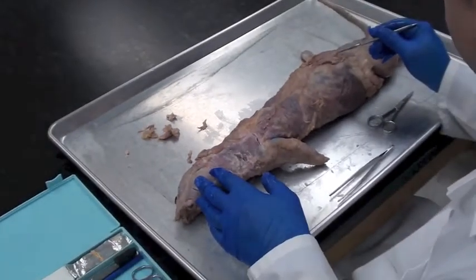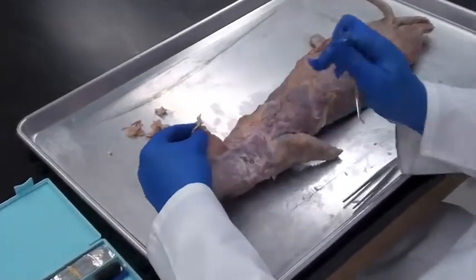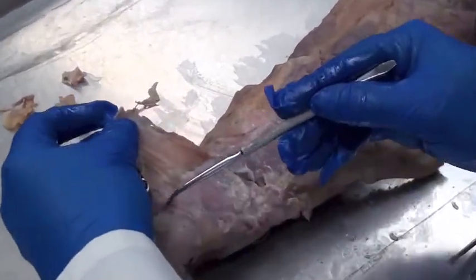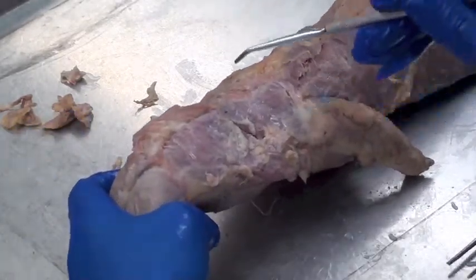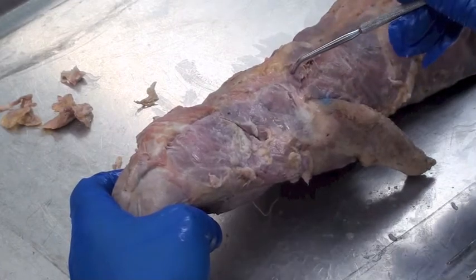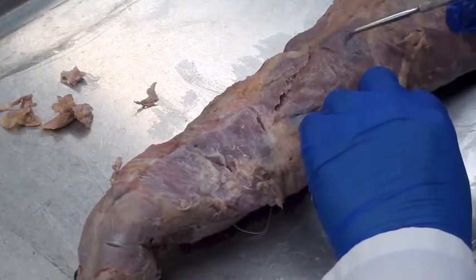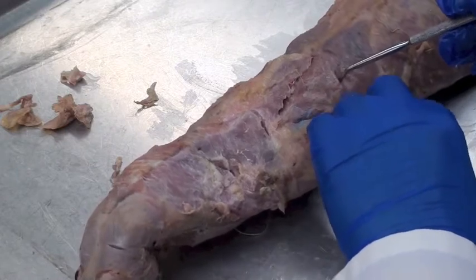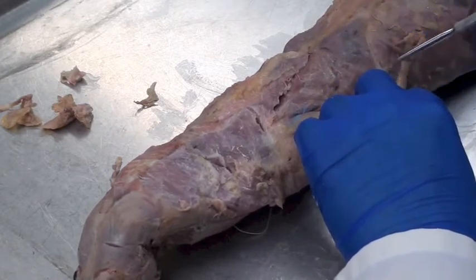To summarize: in the mink's lower back area going up the middle of the back, we called this cutaneous maximus. Then the paper-thin muscle on the neck — platysma. Then we had three trapezius muscles: claviotrapezius, acromiotrapezius, and spinotrapezius. Finally, the big muscle in the mink's and in humans' back — latissimus dorsi. Most importantly, latissimus means widest — latissimus dorsi, widest back muscle. That's how it's named overall. Thank you.